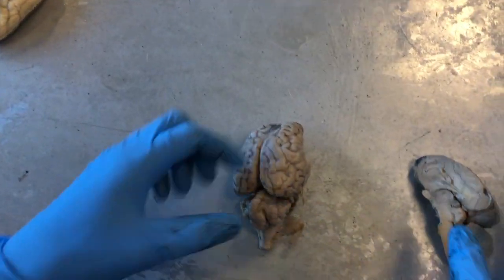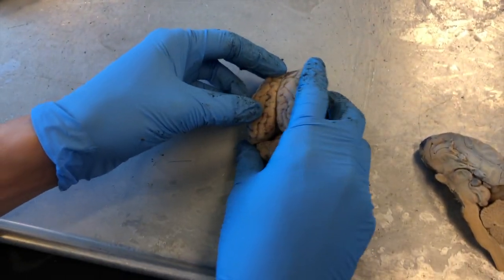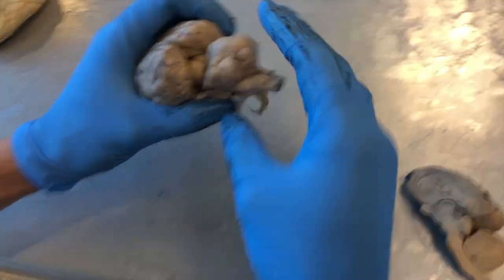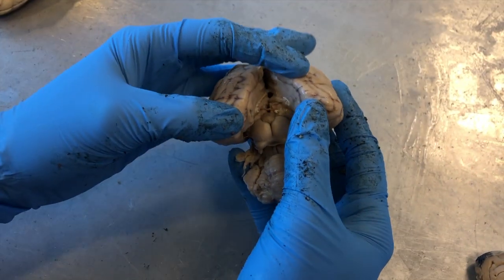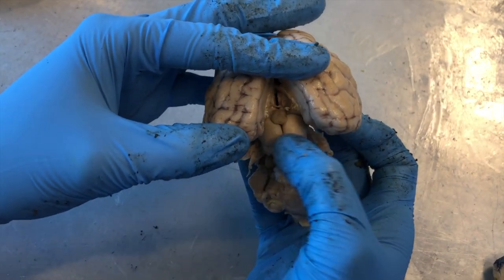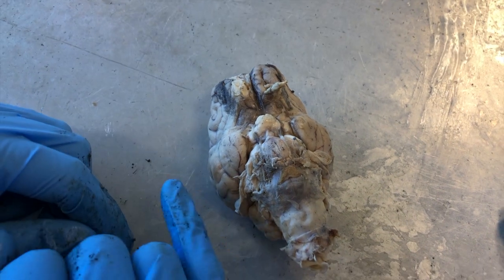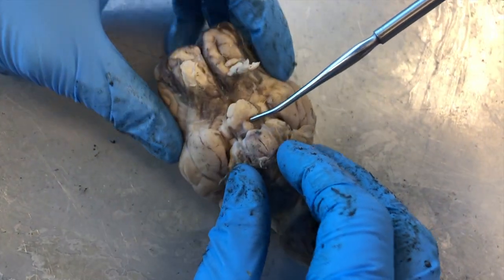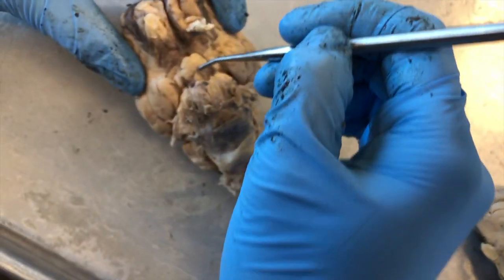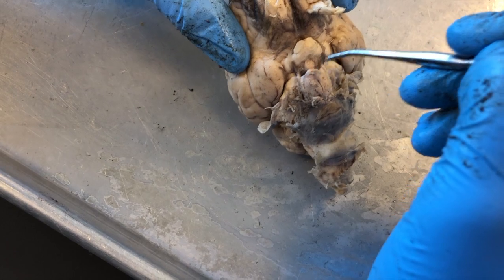Next we'll look at the sheep's brain. There are only three things to identify for this lab exam. Starting with the full brain: the pineal gland — use the cerebellum as your landmark. Pull down the cerebellum and separate the lobes, and you'll see this little nodule — that is your pineal gland. Flipping the brain over, use the optic chiasm as a landmark. Just below that is the pituitary gland — this one is broken, but a small piece remains. The pituitary is a tiny nodule hanging off the brain.